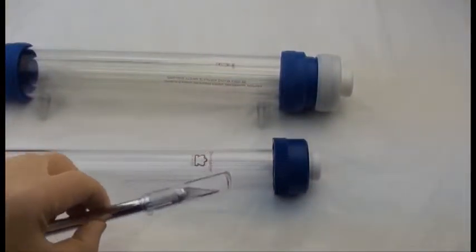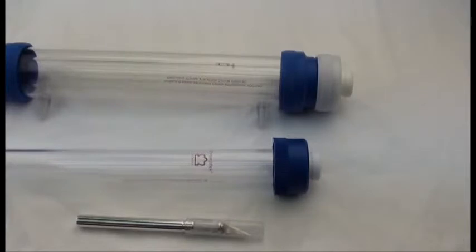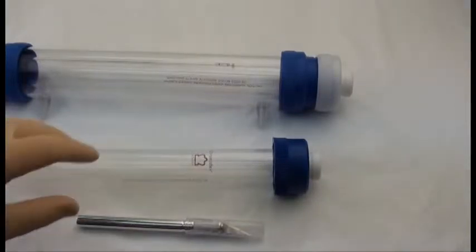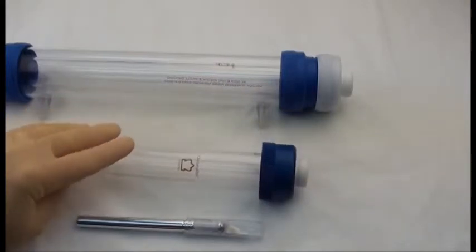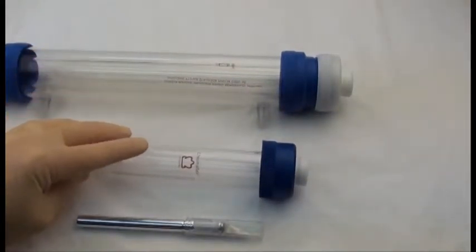So what you'll need to do this operation, you'll need an X-Acto knife and your replacement bed support. So I'll use the standard column. I have a jacketed one and a standard one.